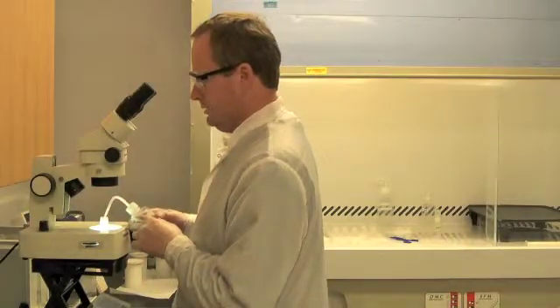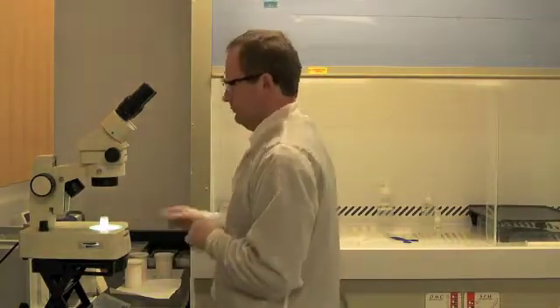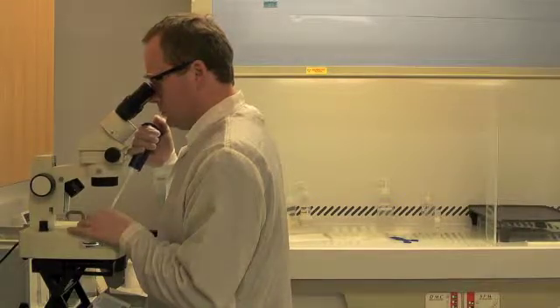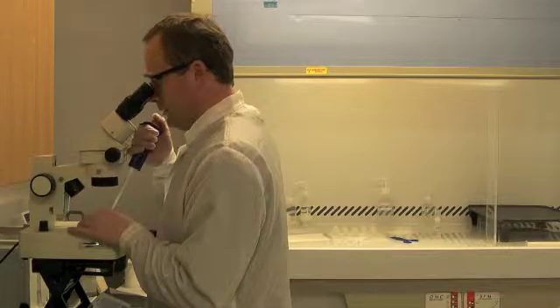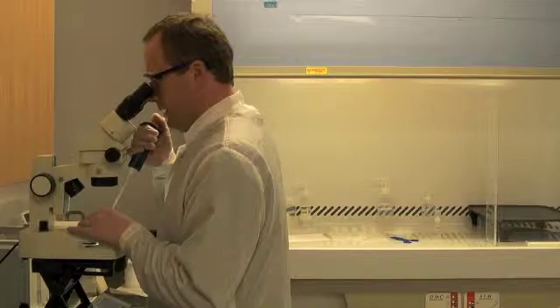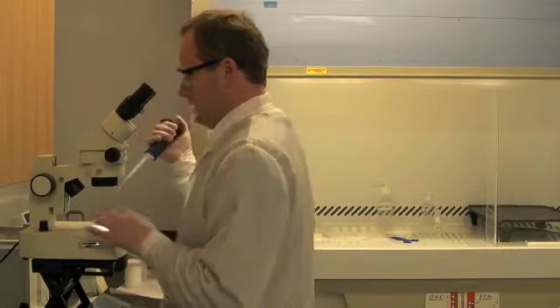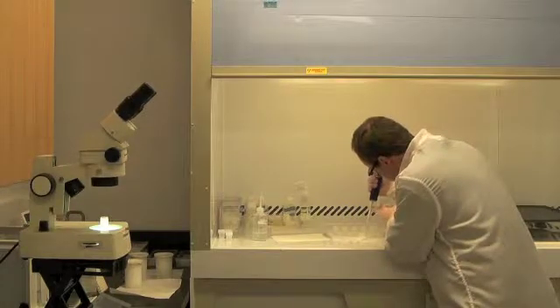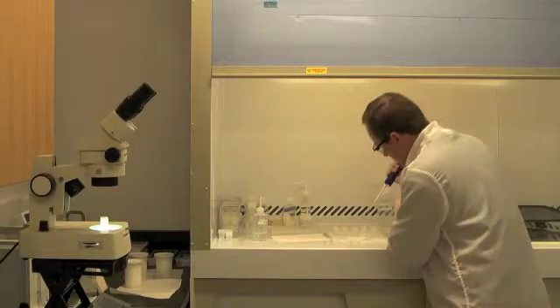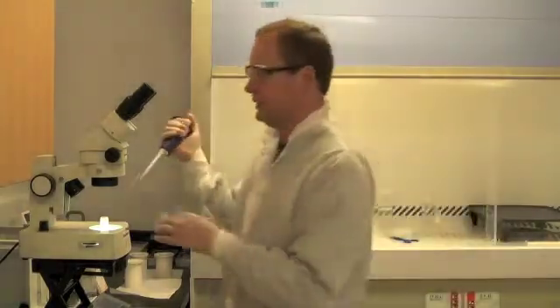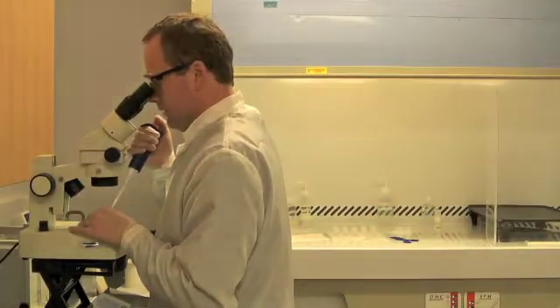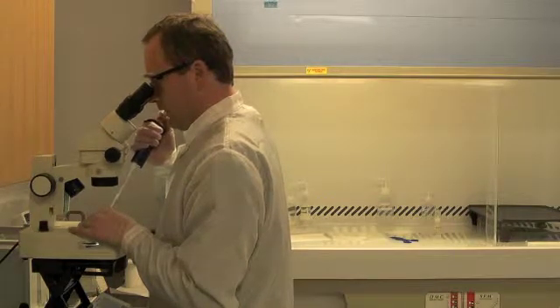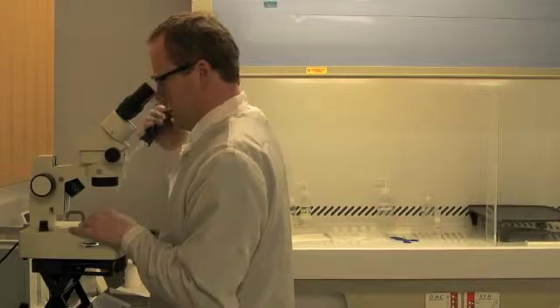Add another aliquot of acid. And now I'm going to pick up the crystal in a small amount of nitric acid and transfer it into my microcapsule. I'm going to check that that transfer was successful by pipetting a small amount of acid in and out of the tip, making sure the crystal does not fall back in the beaker.